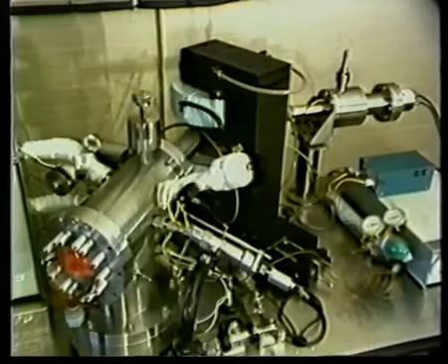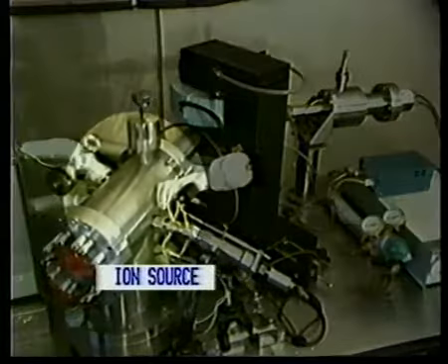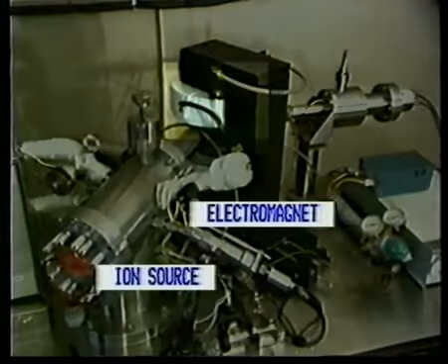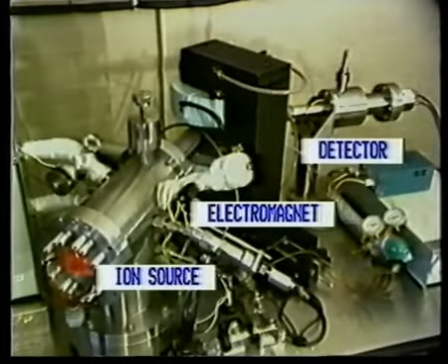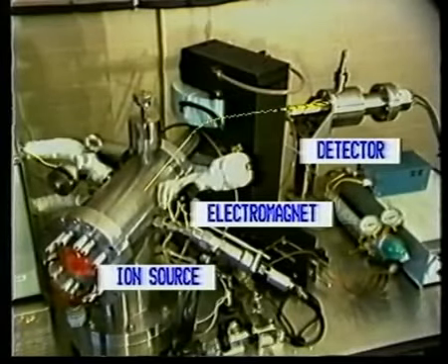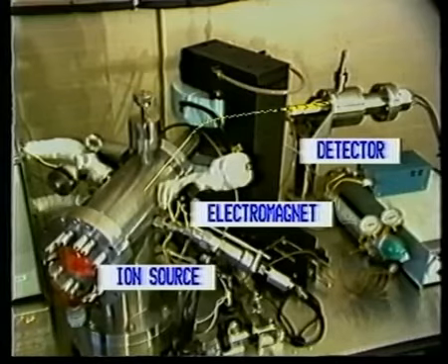Here you can see where all the main parts of the mass spectrometer are housed. The ion source on the left, the electromagnet in the middle, and the detector on the right. The yellow line shows the way in which a beam of ions leaves the source of the ions, curves in the vertical magnetic field, and passes on to the detector.